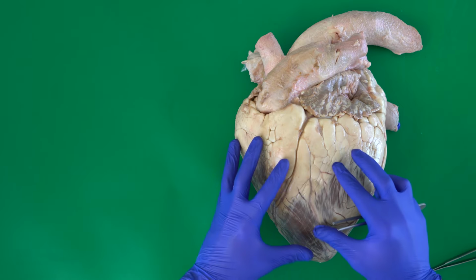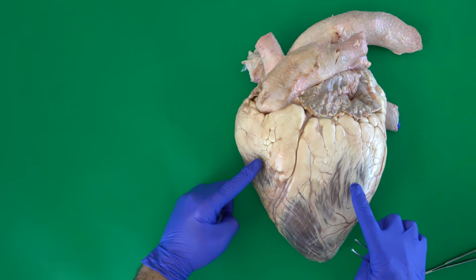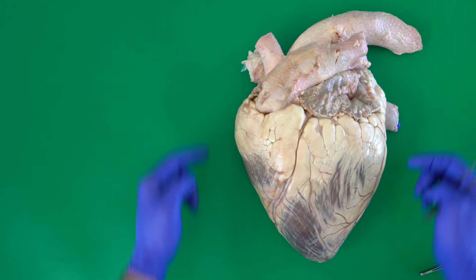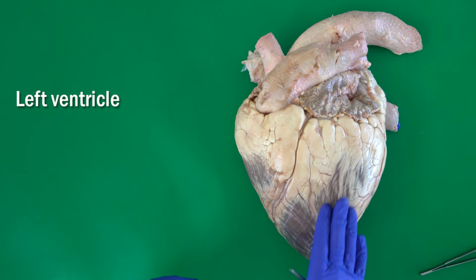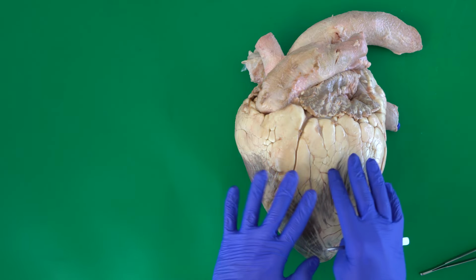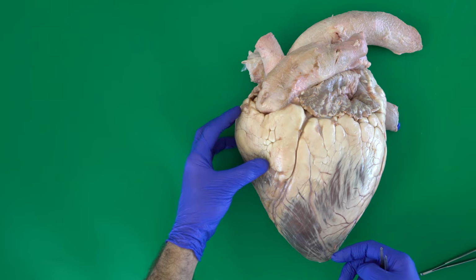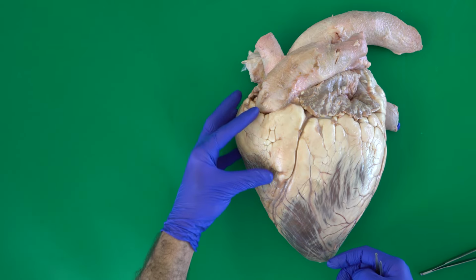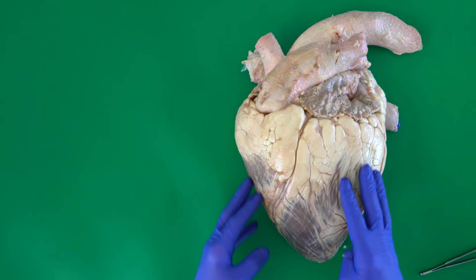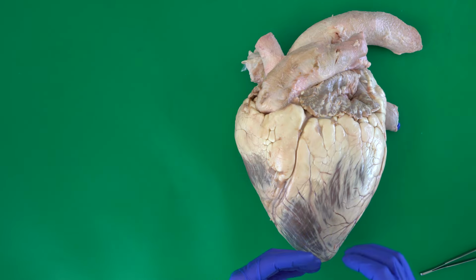In general, the heart has four chambers: two ventricles and two atria. Atria is the plural of atrium. Here we have the left ventricle and here we have the right ventricle. Actually, in the left view, we can see the right ventricle faces cranially, so it's not on the right side. The same for the left ventricle, which is located caudally, not completely on the left side.